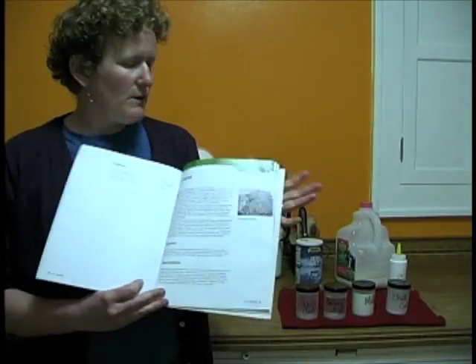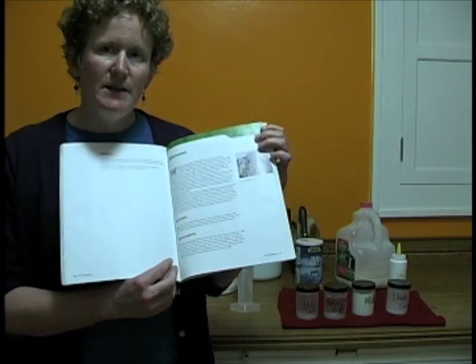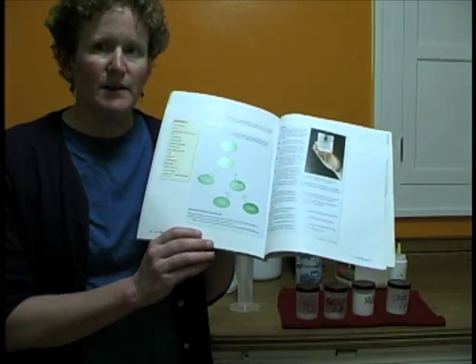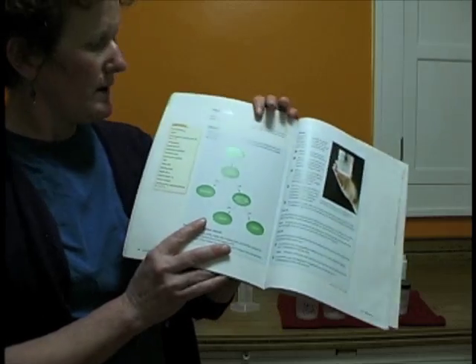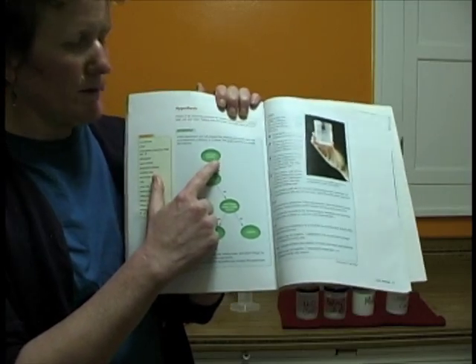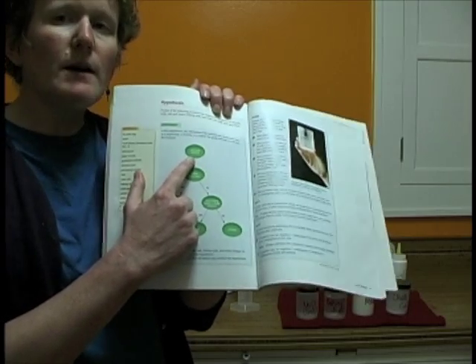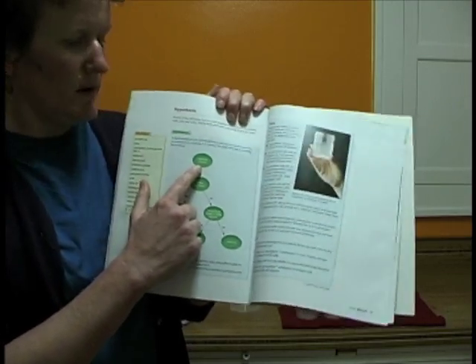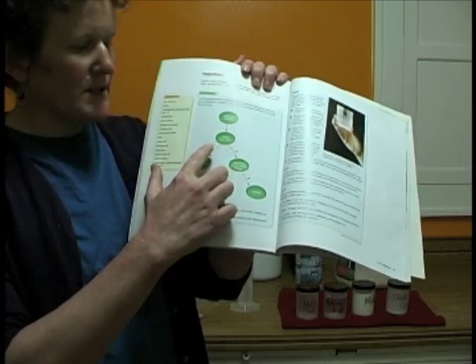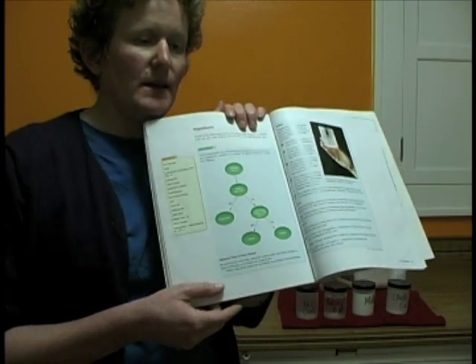On lab 6.03, which is labeled lab 20, on page 69 in your lab book. On page 70, there's a very important chart here that's going to help us make decisions about our 4 unknown mixtures. We have salt water, baking soda and water, chalk dust and water, and milk, which is primarily water. We're going to make some decisions based on some simple tests in part A, B, and C.